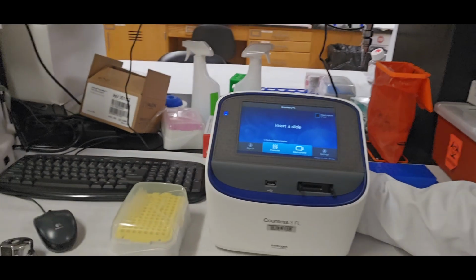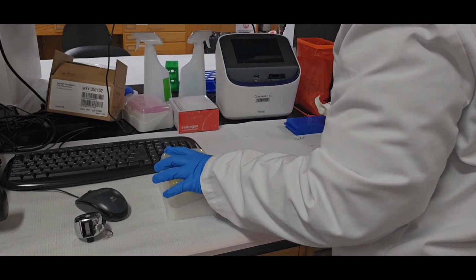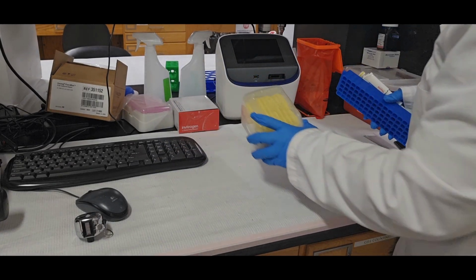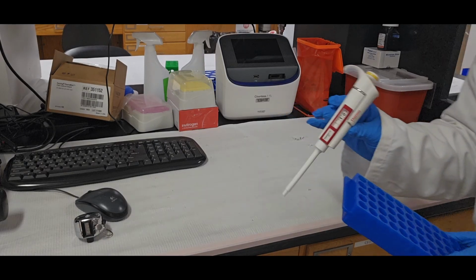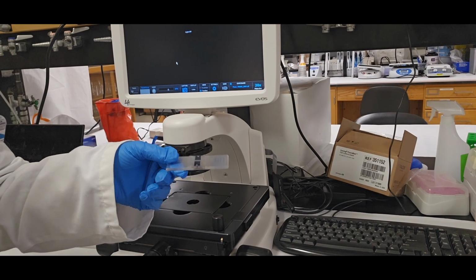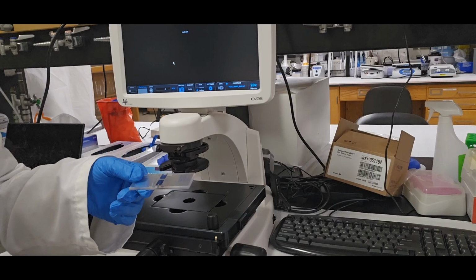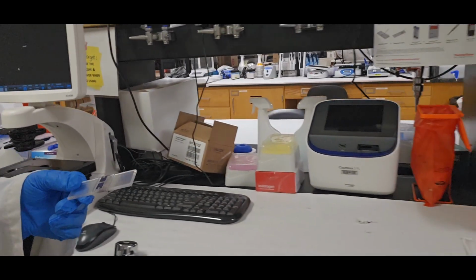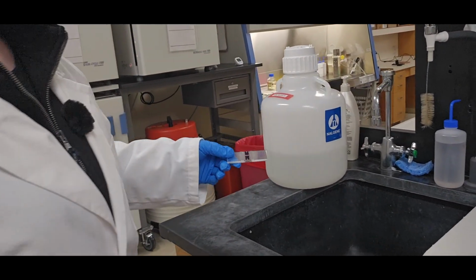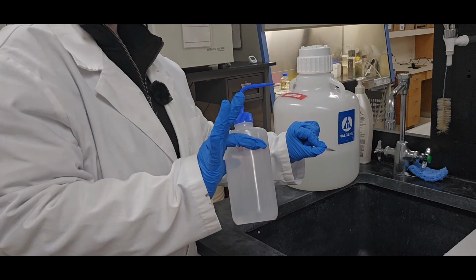So now I'm going to clean up. And clean up is turning this off, putting everything back where you found it. All of this stuff goes back. Trypan Blue is closed and placed back up there. This goes back on the other side of the bench. Very important, this hemocytometer needs to be cleaned correctly, which means you take the glass slide off, you bleach it, ethanol it, and then put DI water on it. Sometimes I just do ethanol. I think that's sufficient. But as long as you are doing something to kill or deactivate the biologics on that. So ethanol bottles kept at the sink here.